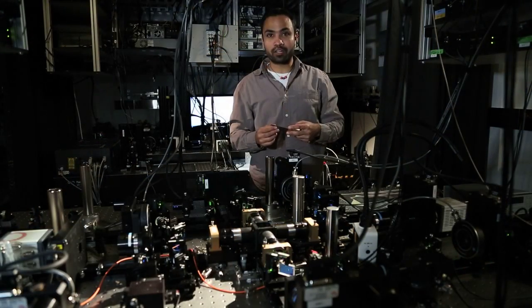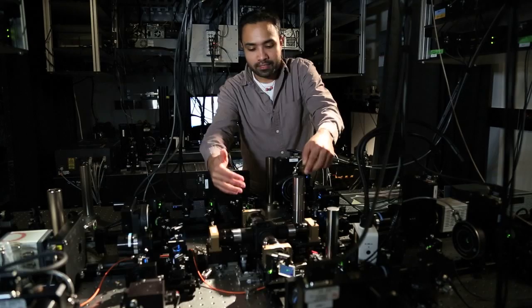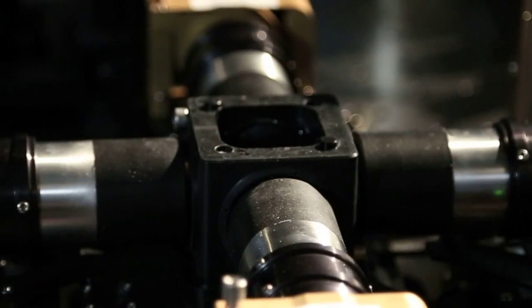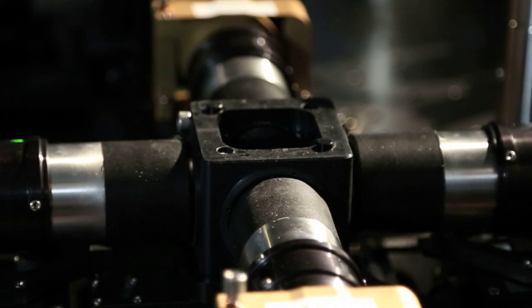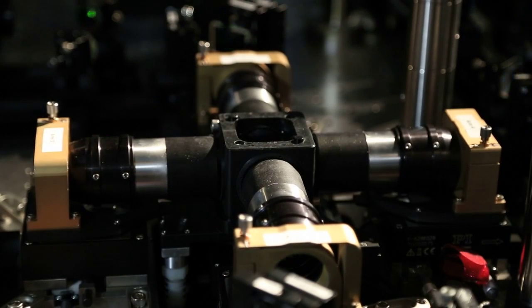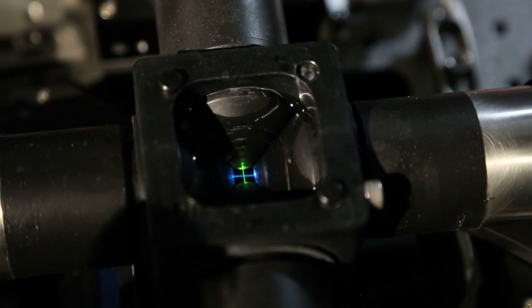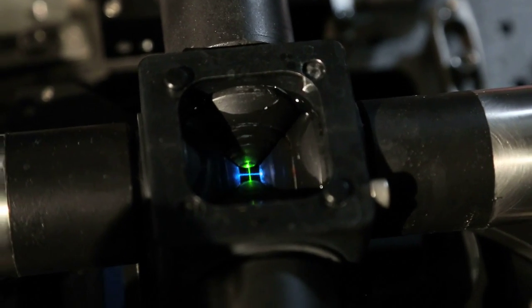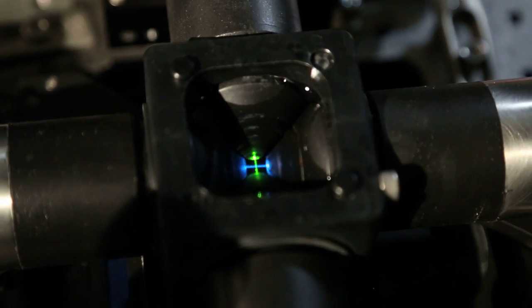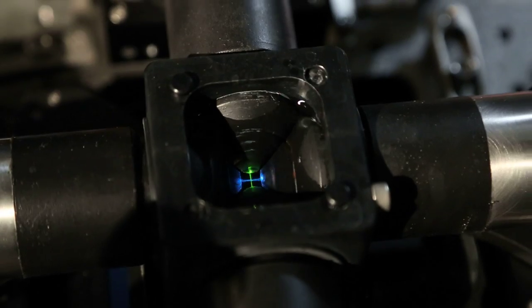IsoView is a very sample-centric design, so this is the center of our stage. And this is where I would slip in a sample in a cylinder, and the sample sits inside, flanked by these four objectives. So as you can see, these objectives are doing their sectioning by moving in and out across the sample simultaneously. We have these photons at the center of the stage coming in from all four directions, but we also have the degree of freedom to offset where they're coming from.